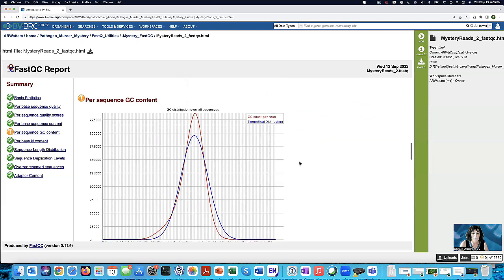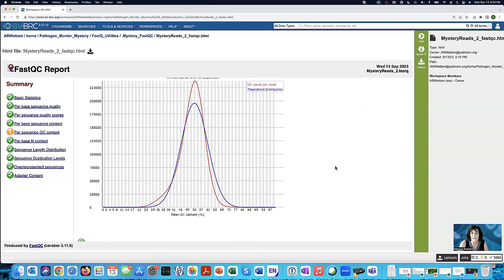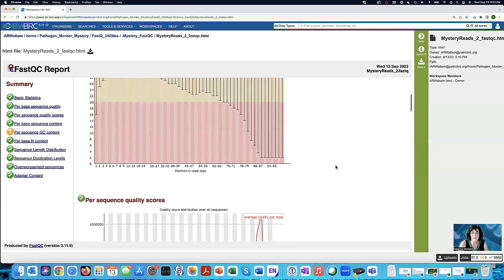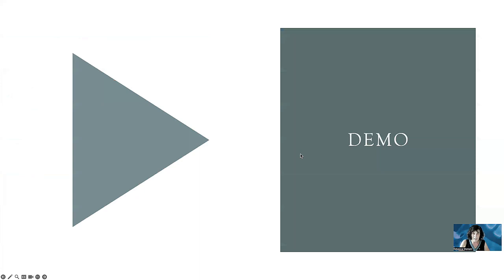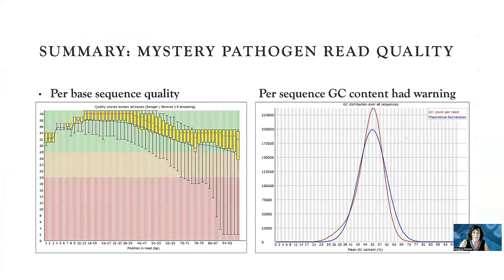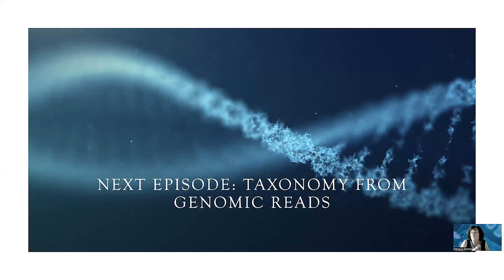So as far as I'm concerned, we're going to be good to go with this. Let's go check out where we have the warning sign. Looks pretty similar to the other guy. Okay, so I think I'm going to give this 2 thumbs up, and I think we can proceed to the other steps. But let's go back to our slides because I can't let you go without boring you just a little bit further. We did the demo. I showed you how to do it in BVBRC. And the mystery pathogen read quality, good. We like it. There was a little bit of a warning with this one, but nothing I'm going to worry about at all.